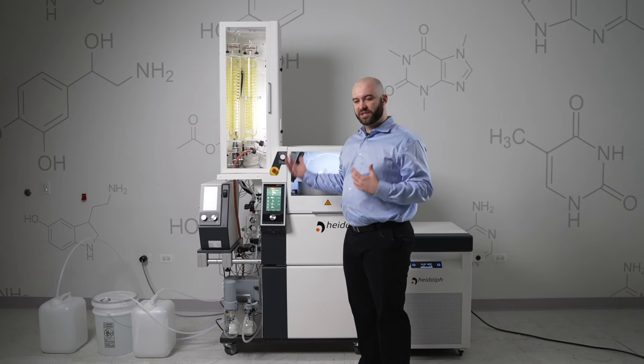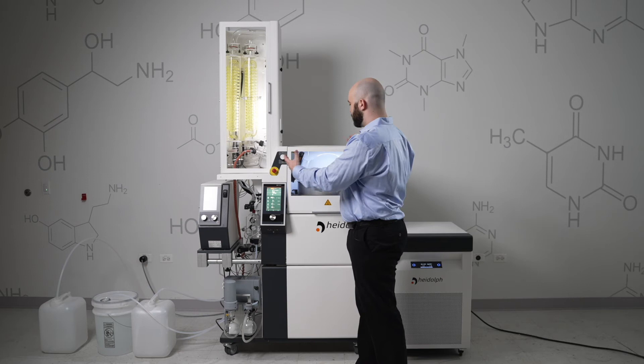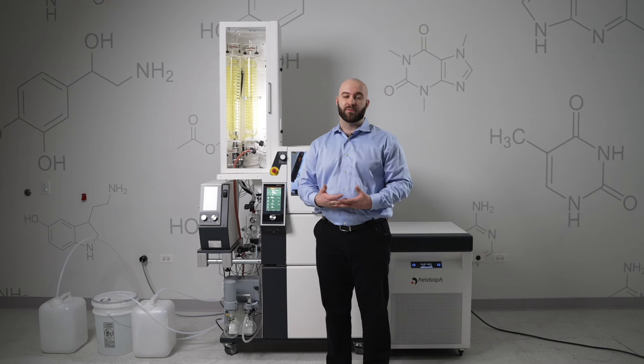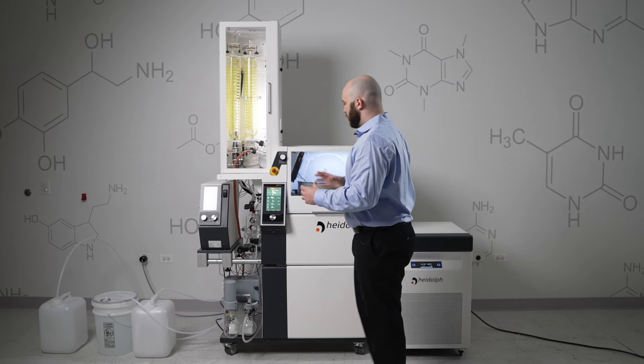That process will continue as many times as it takes until you only have residue left in your evaporation flask, in which case the system will then turn off vacuum and overpressure the entire system in order to force that residue out. That overpressure system is what lets us remove that residue so quickly and at high viscosities, allowing you to remove things as viscous as cannabis oil.